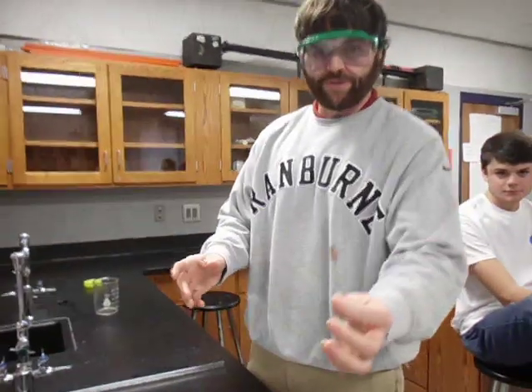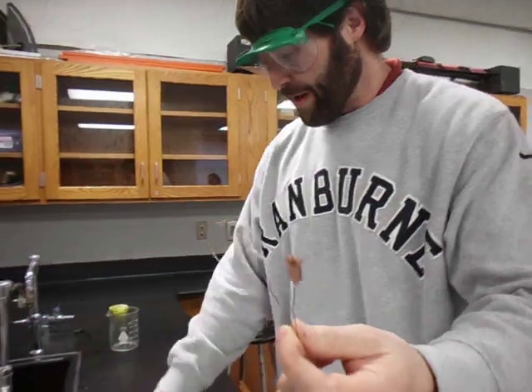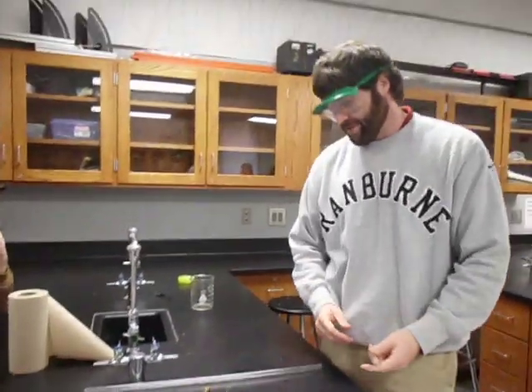You're going to need a copper cage, which is nothing more than a bunch of coiled up copper wire, and you're going to need a stopper. That's the only thing you're going to need from me.